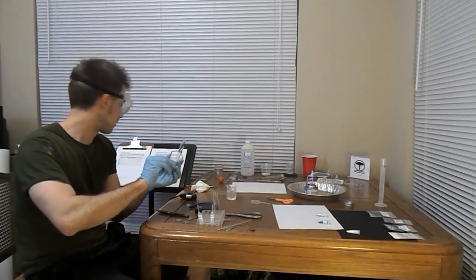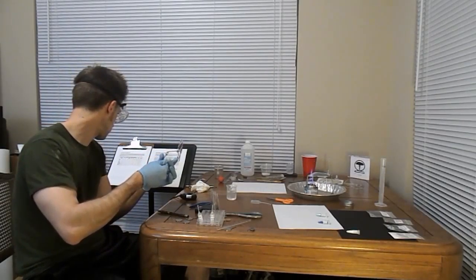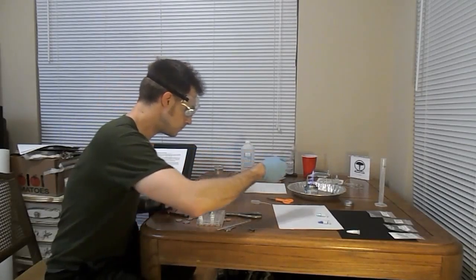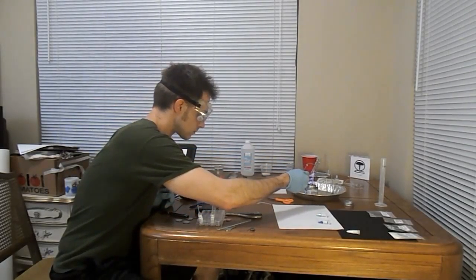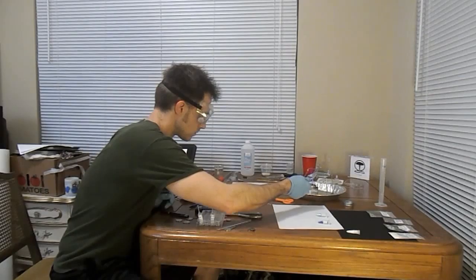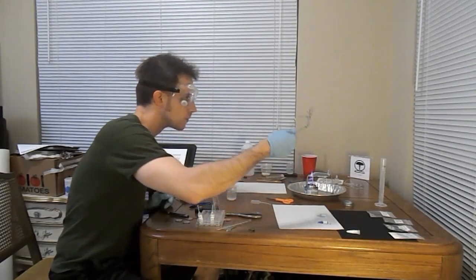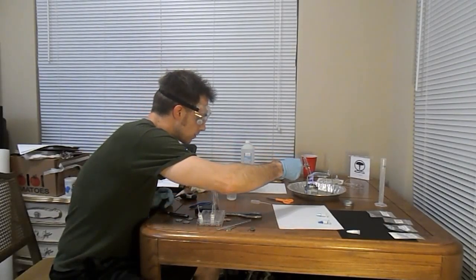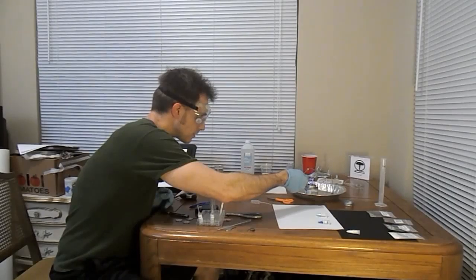Alright, we're going to go ahead and apply some heat here. Looking for changes of some sort.